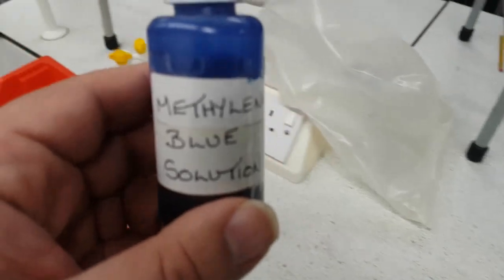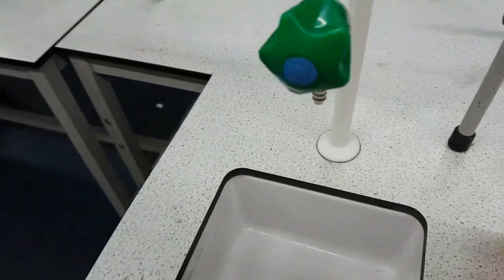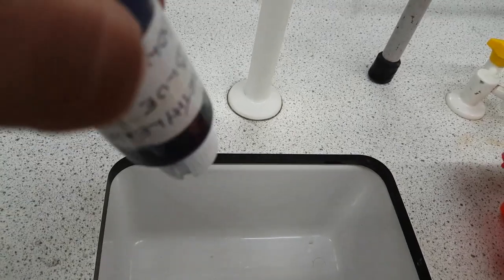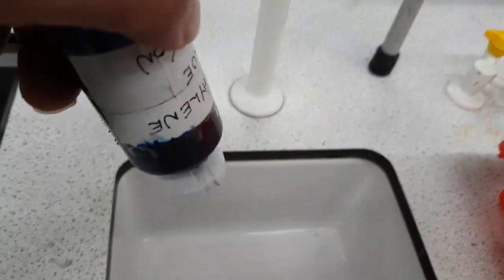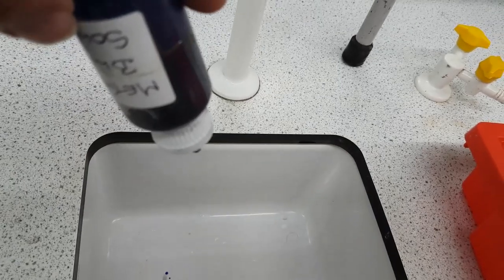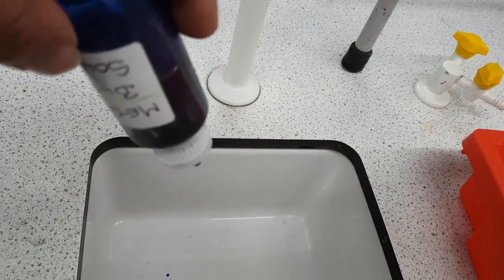I'm going to give you a hint as to how to use this because one of the problems is that people end up really dropping out loads. So basically all you're going to do is you're going to see how easy or hard it is to come out of the bottle.